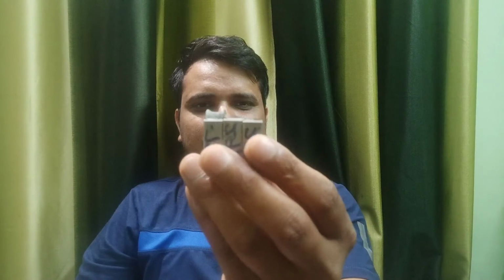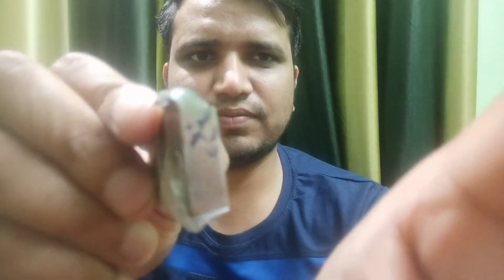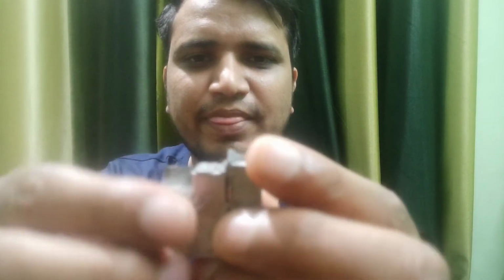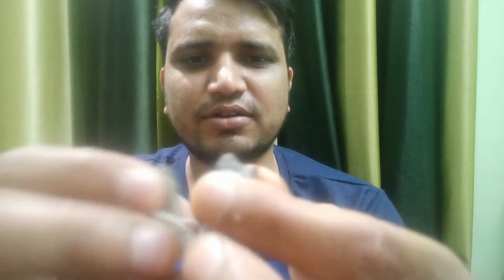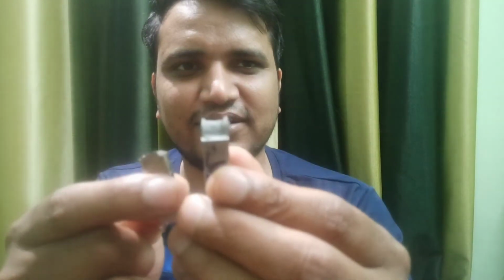Okay, so these were two things, and I have one more thing, which is the impact sample. See, these are three impact samples. I have taken the half part. Now if you see the first one, these portions are called the lips, this portion which is extra. This is called the shear lips basically. If you see, the shear lip is maximum in this case. This is the sample where we have the maximum shear lip, and this is the sample where we have the minimum shear lip. If you see, the surface is very flat, that means it is a kind of brittle fracture, and this is a kind of ductile fracture.